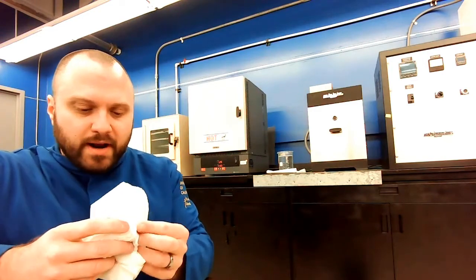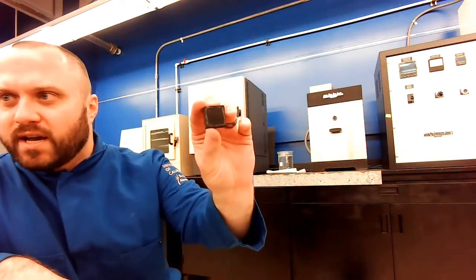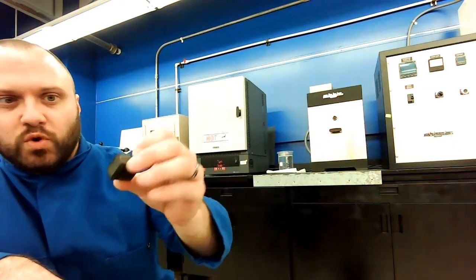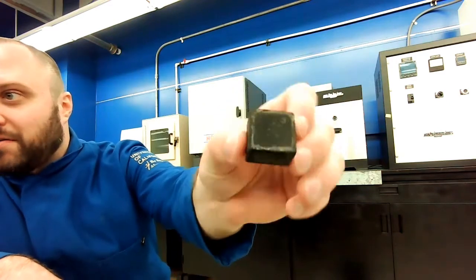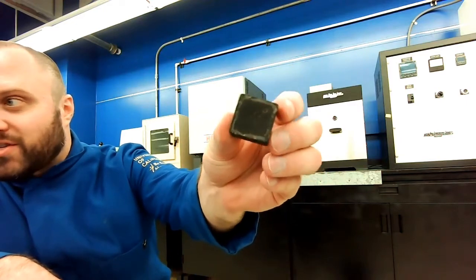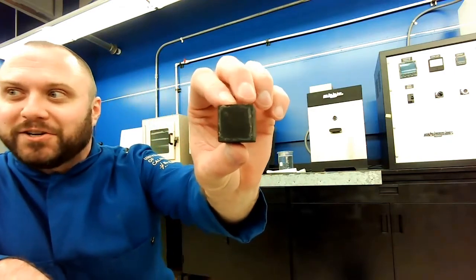I didn't have to worry about it here, but if I, for example, had a really thin steel part, that rapid cooling could happen non-uniformly and the sample could warp or something like that. That's not really something to worry about with these. These are just blocks of material and we can do whatever we want. But I will point out that this thing looks very different than it did before. It was shiny, well polished. All this surface oxide has formed. We gave it a lot of temperature. It didn't help that we put it in salt water. That was part of it too.